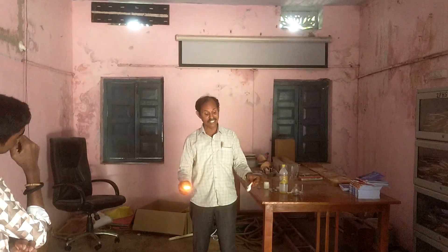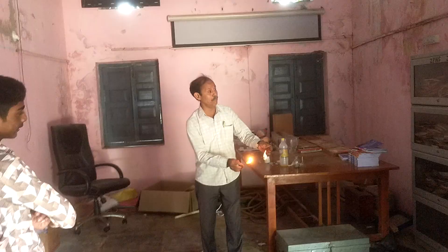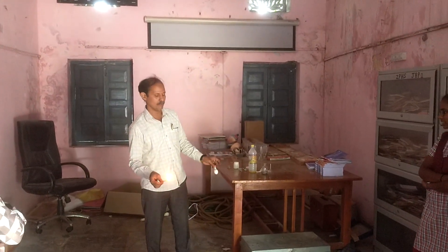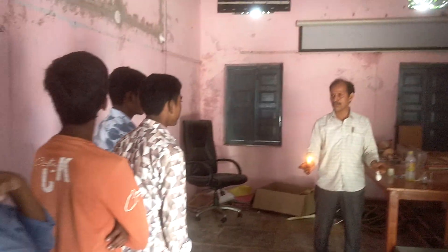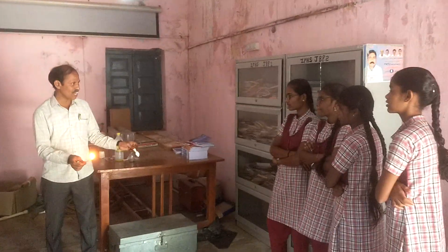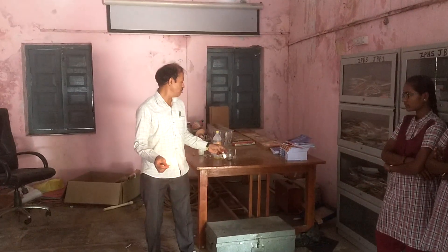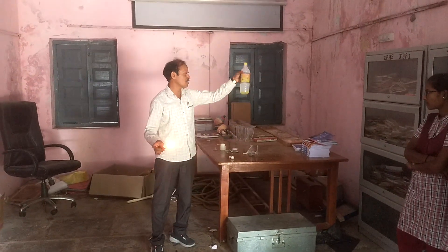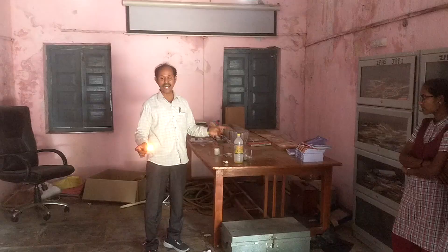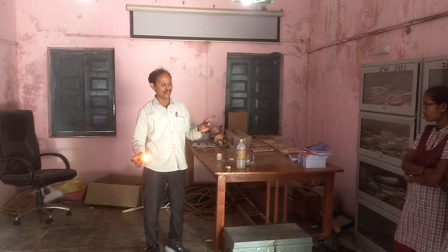It burns with a pop sound and it stops the flame immediately. This gas is nothing but hydrogen gas. From this experiment, what do you conclude? Acids react with metals to liberate hydrogen gas.